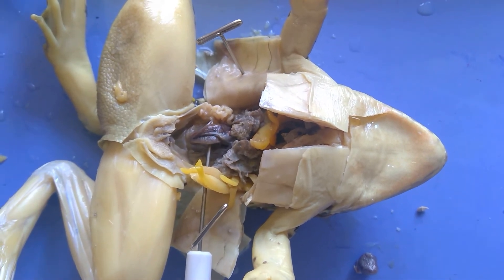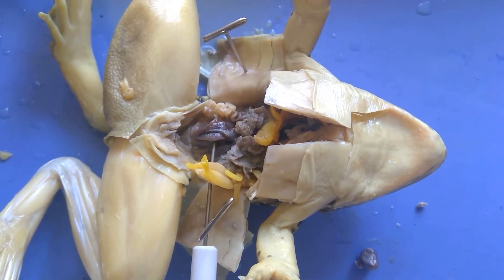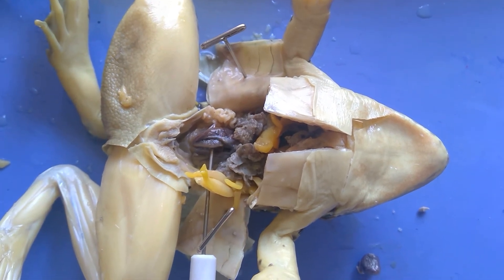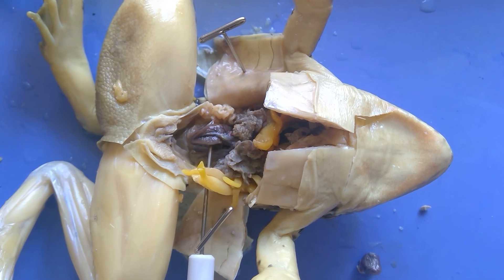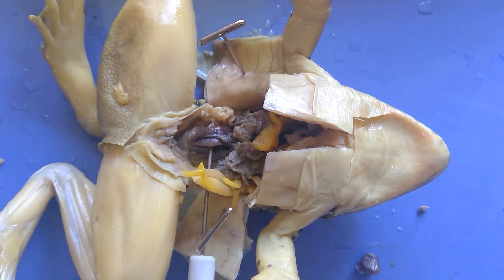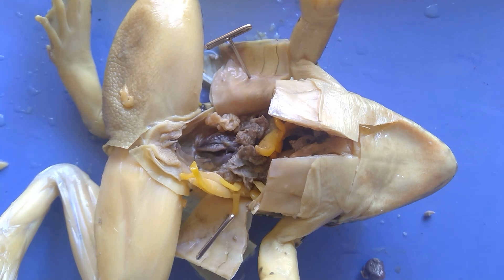Some birds and reptiles also have a cloaca, but there are also some reptiles and birds that have a penis and a vagina — it really depends on the species. However, all frogs and amphibians do not have a vagina or penis; they just have the one opening called the cloaca.